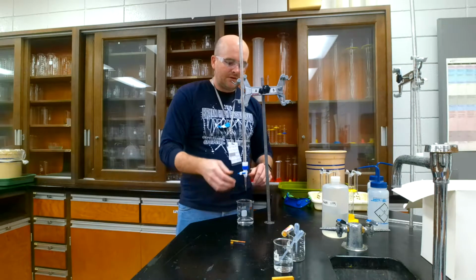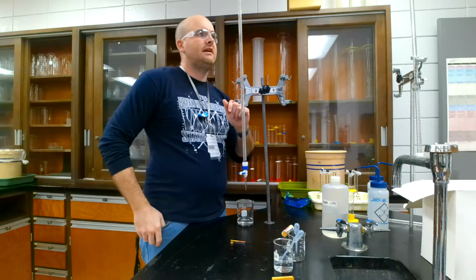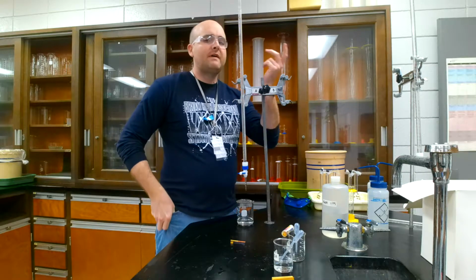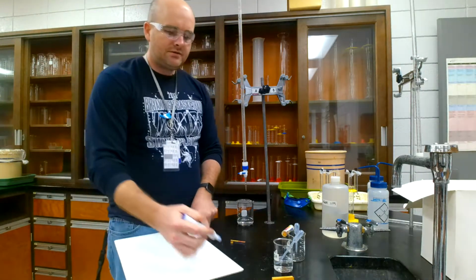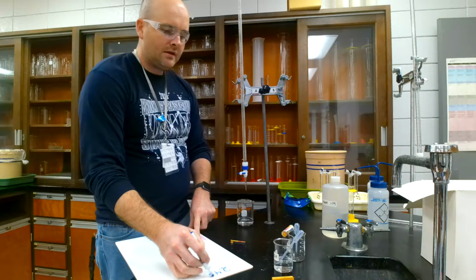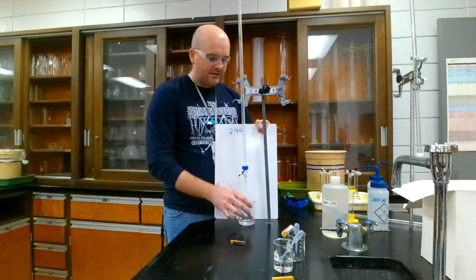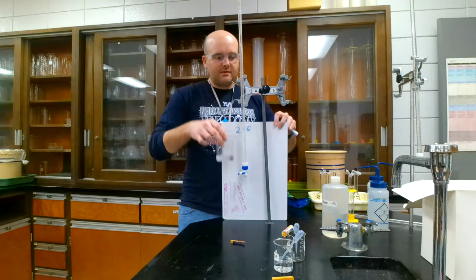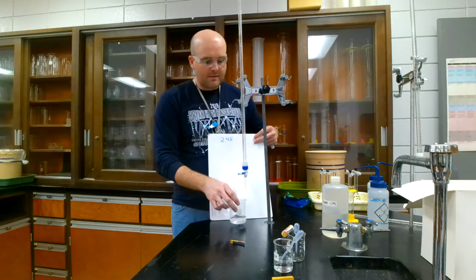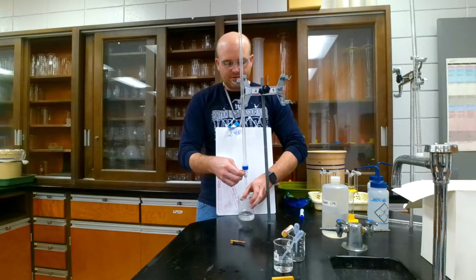Okay, so I am going to start. I'm going to note a volume here. Let's say it is 2.45. Okay, always good practice to write that down. 2.45. And then I am just going to add some. So we're getting close to it, and as you can tell, it is starting to be a pink color. So let me add some more.